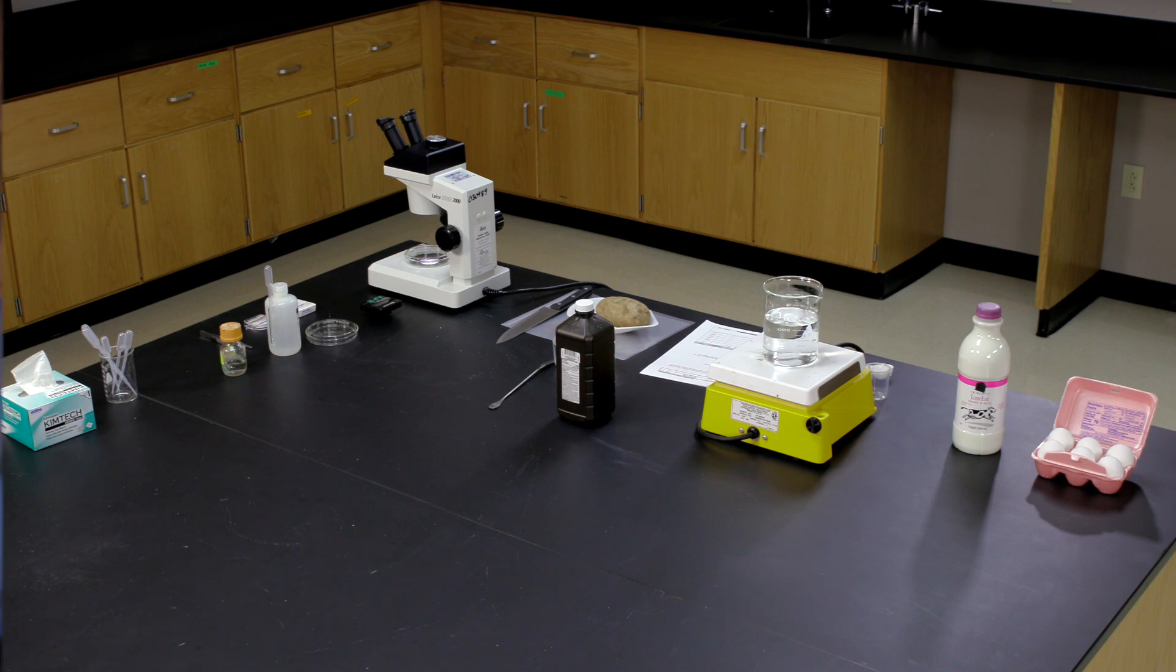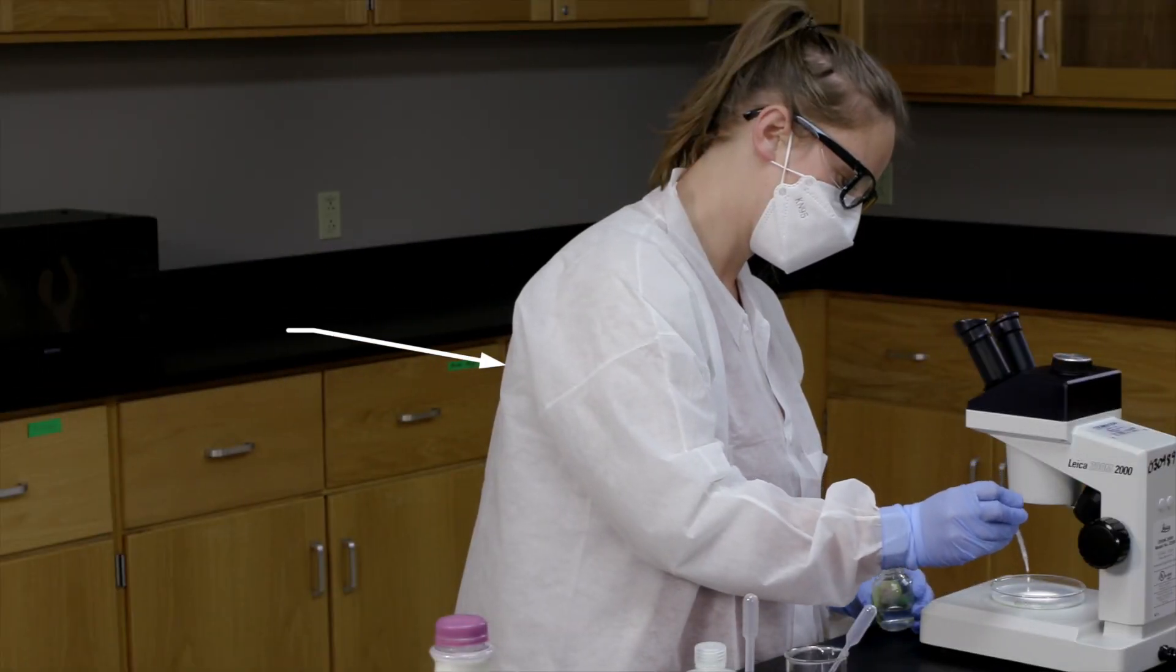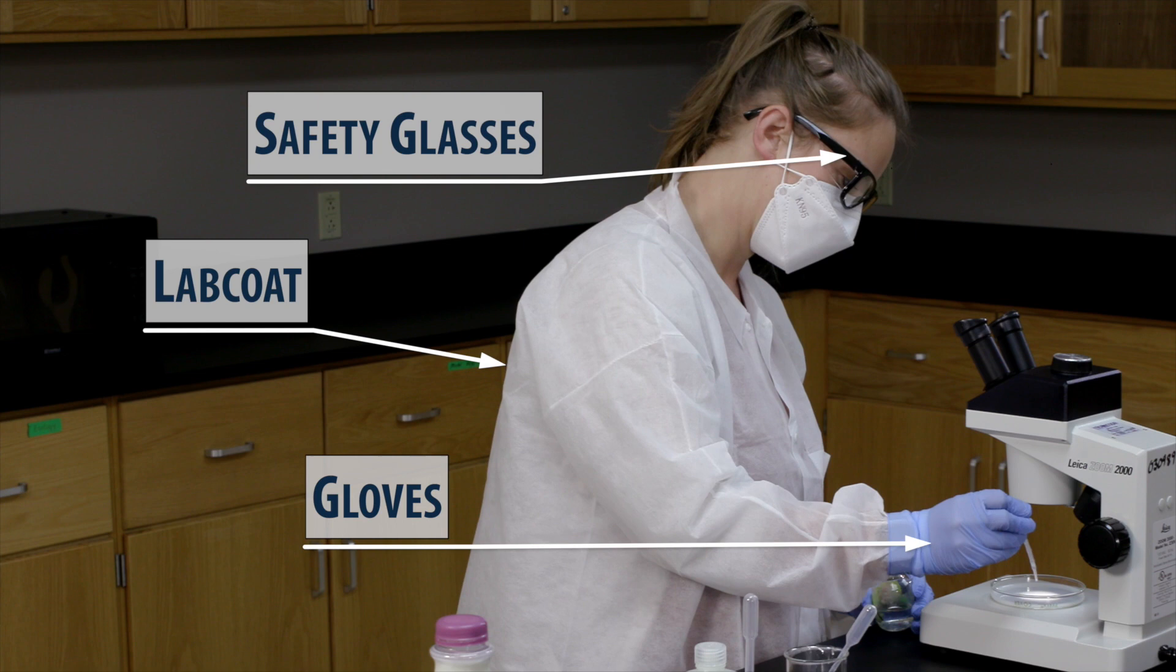Let's try the same experiment, this time in the lab. Always make sure to wear your PPE, lab coat, gloves, and safety glasses.